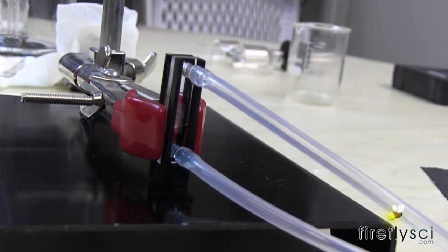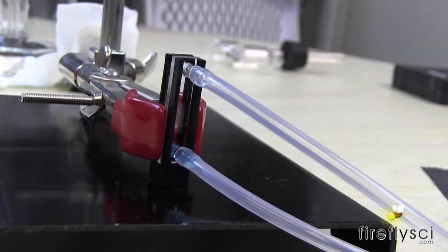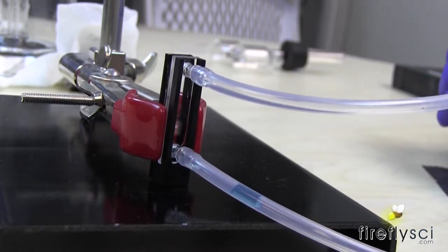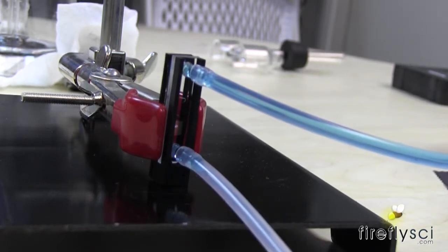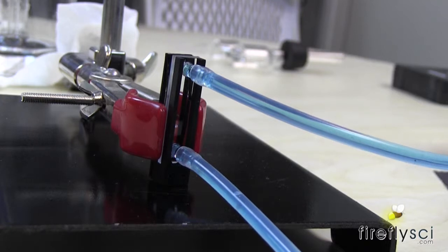There we go. And now the sample is flowing through the cuvette.